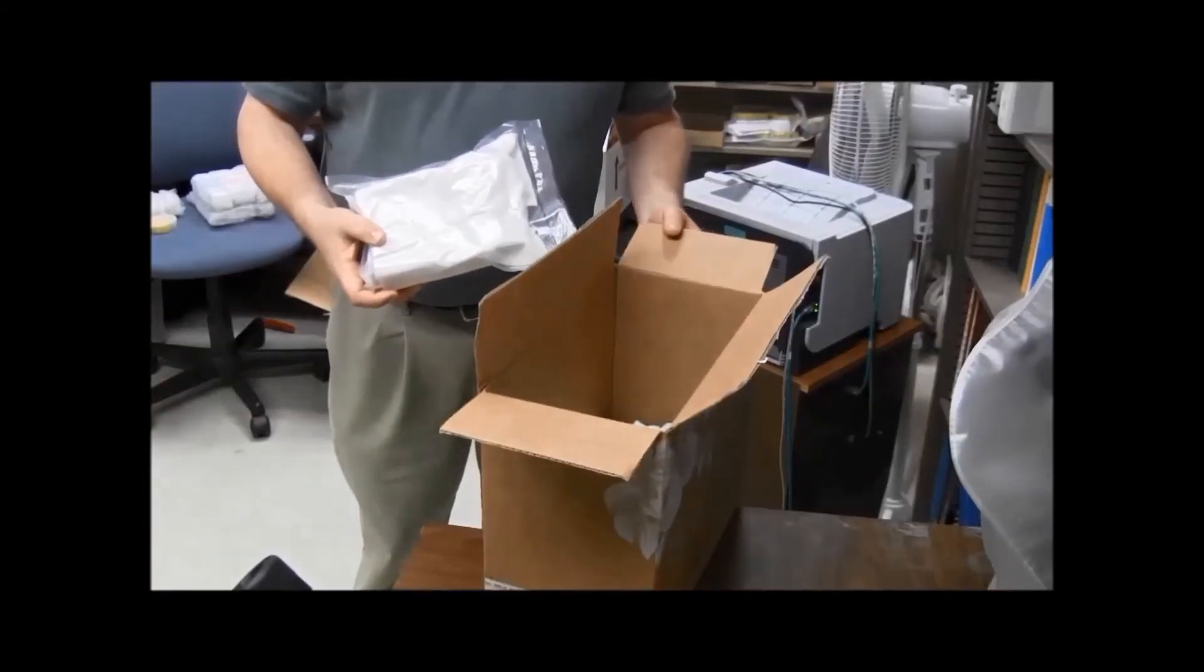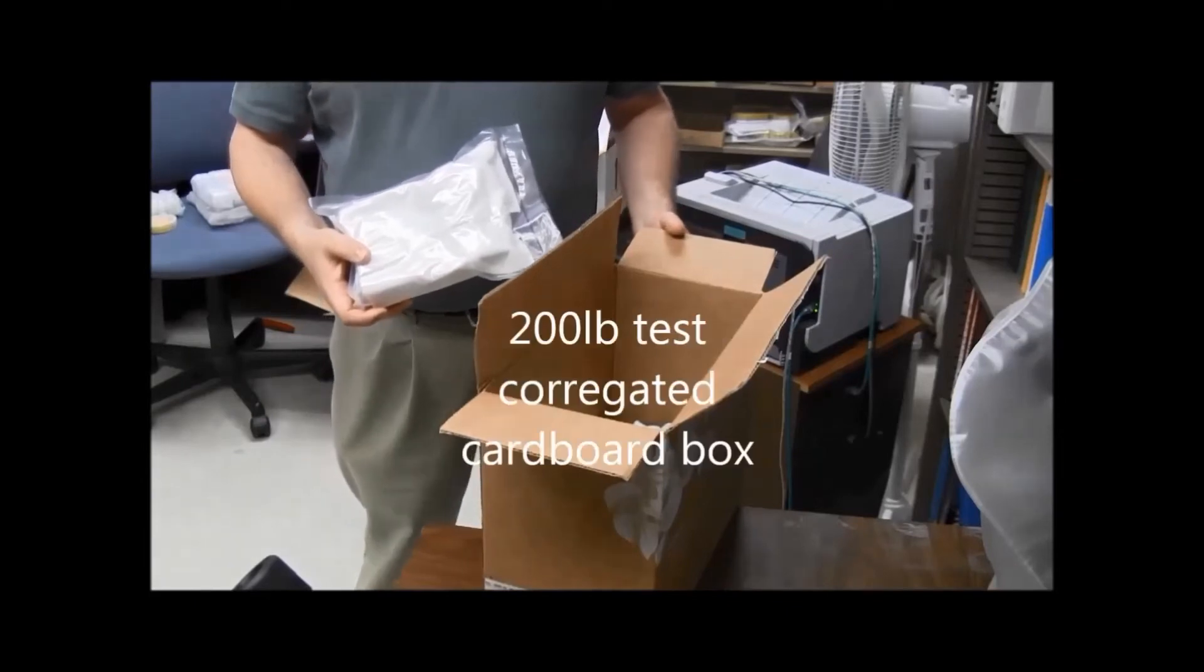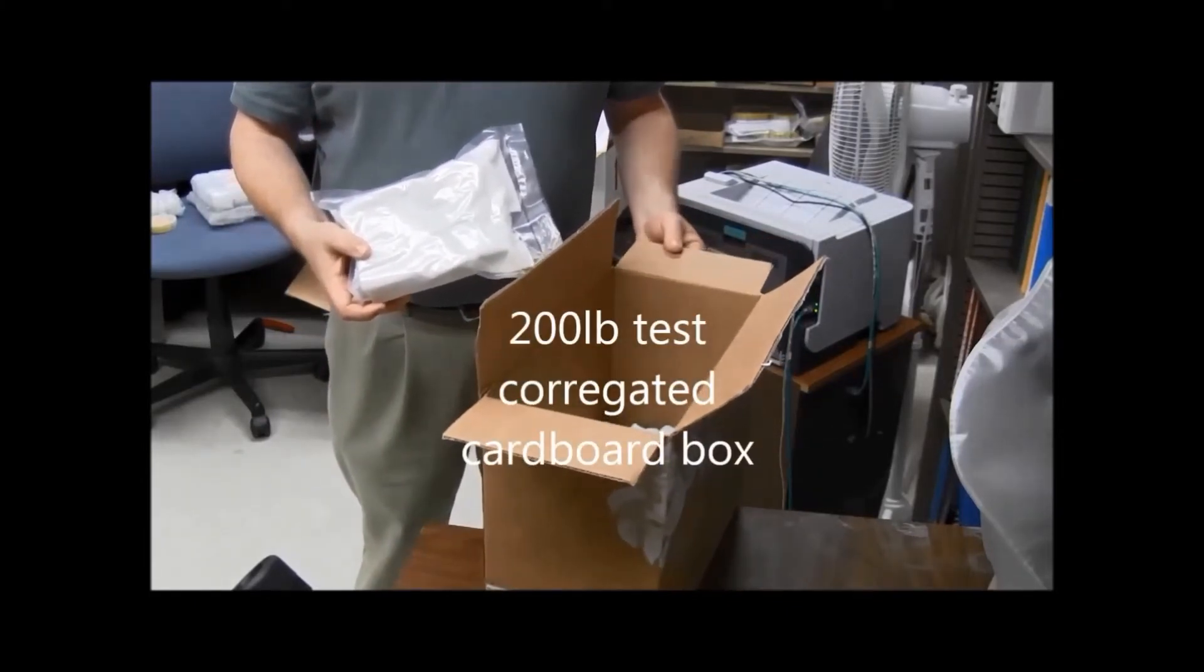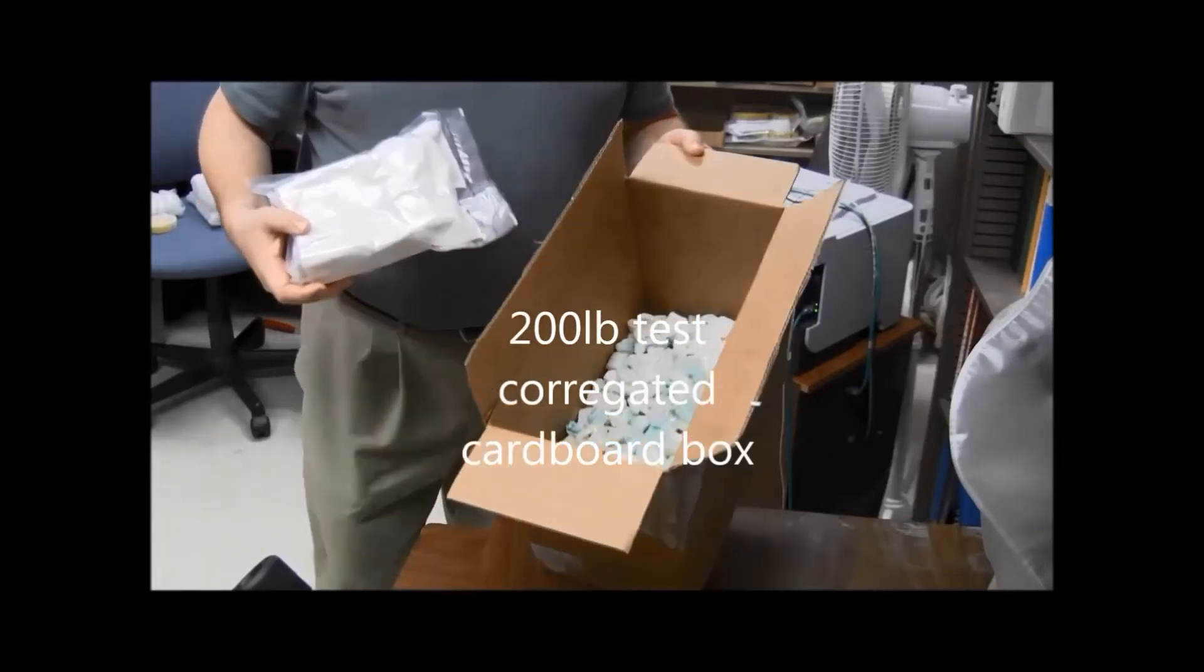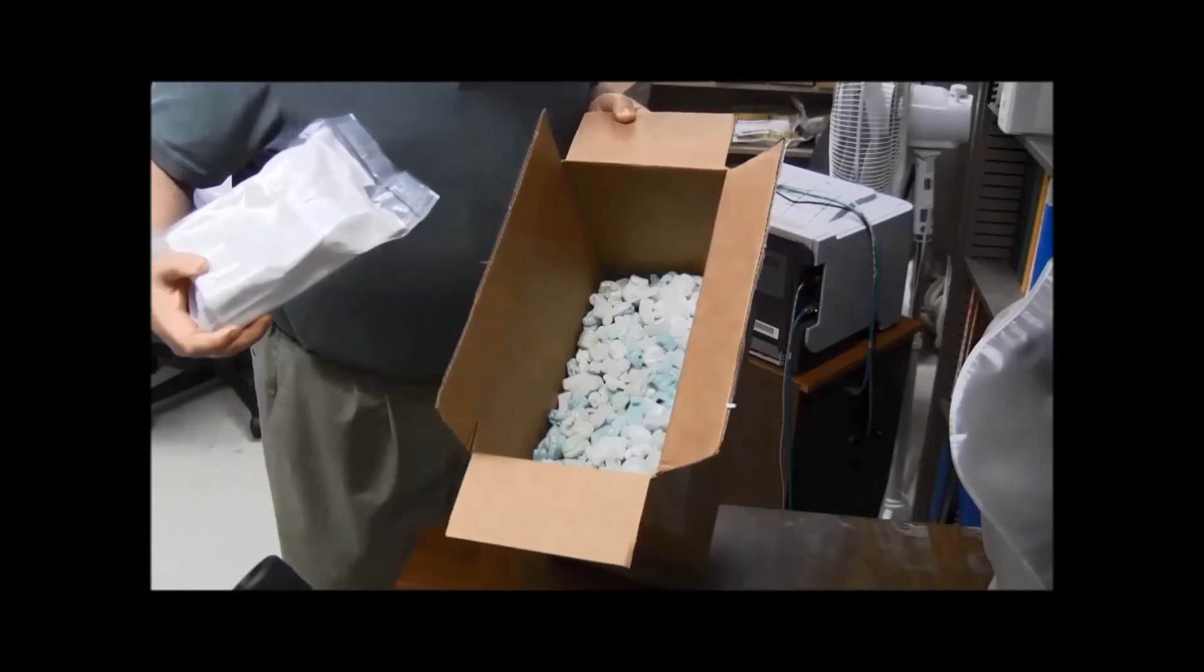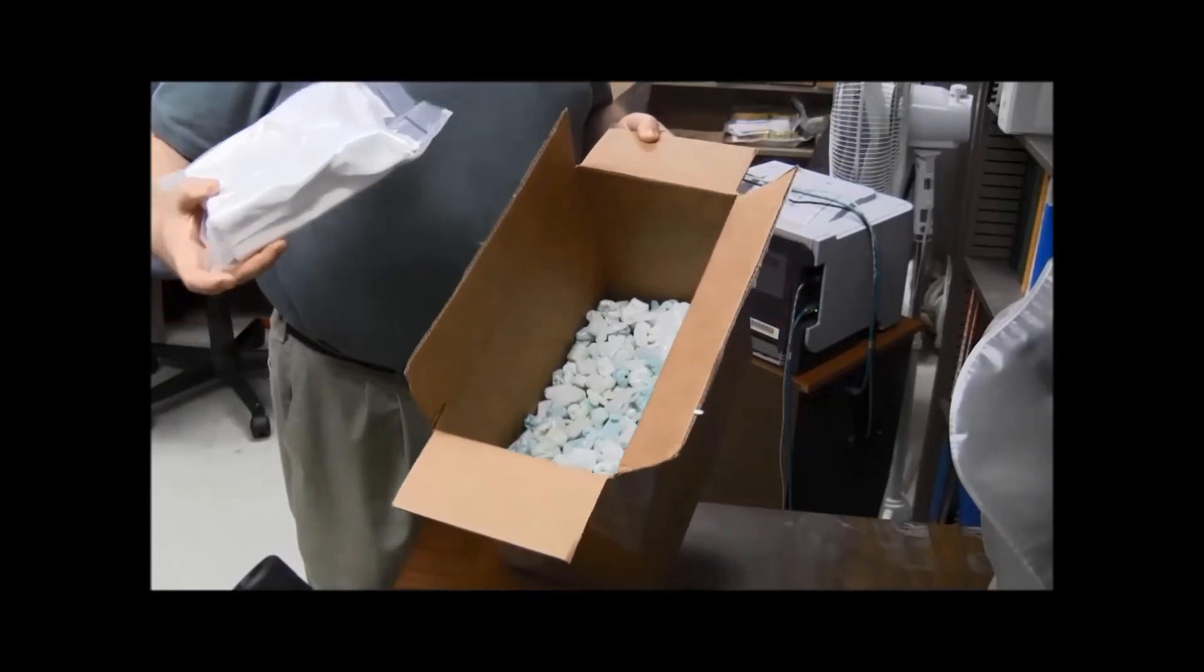So you don't need any special box for this type of shipping. This is just one that I got in the mail and I'm repurposing. So you have plenty of cushioning material. Usually it means styrofoam peanuts, maybe bubble wrap, whatever you have at hand.